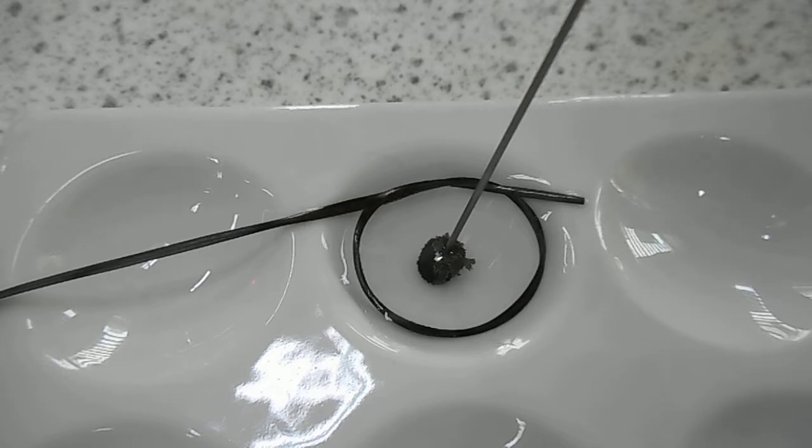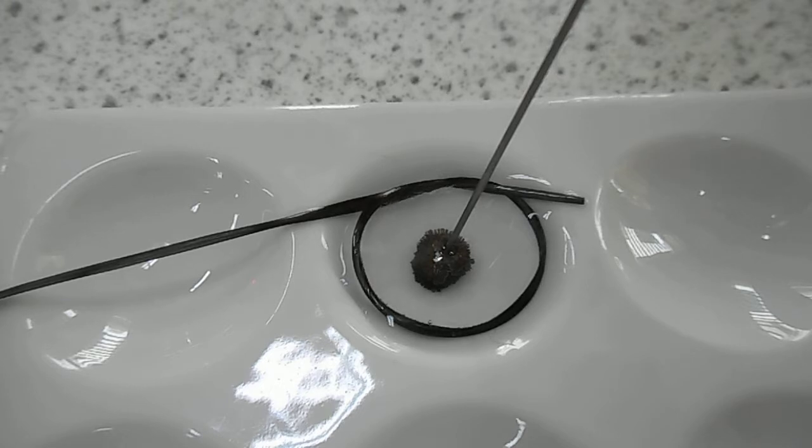Immediately we see the formation of solid silver around the central cathode and this is moving towards the anode which is the carbon fibre around the outside.